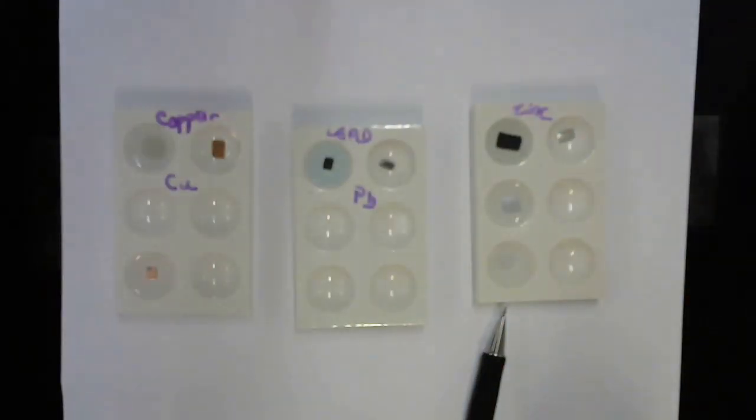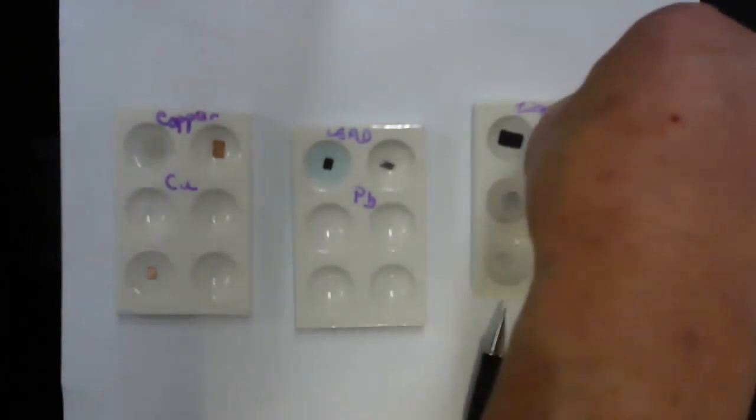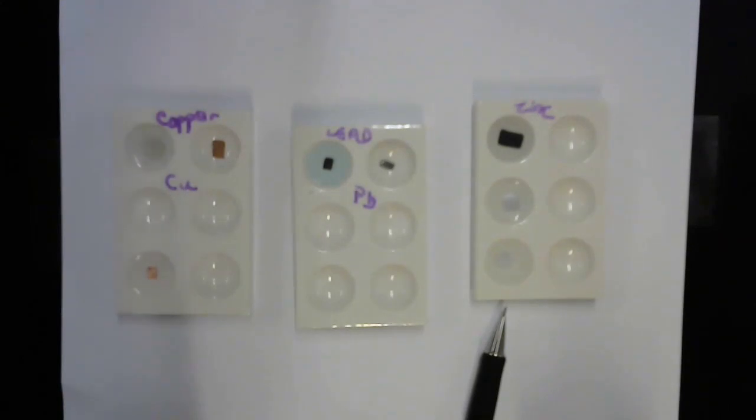Okay, so I'll take my sulfuric acid, carefully add it to the test tube here. Sorry, I'm off camera. You'll just have to trust me on this one. I have to go get another piece of zinc, which, oh, I have a piece of zinc right here. Never mind. I'll just grab that one and drop it in.